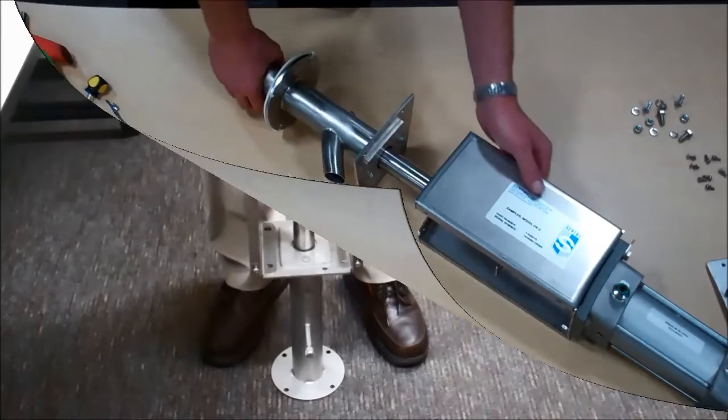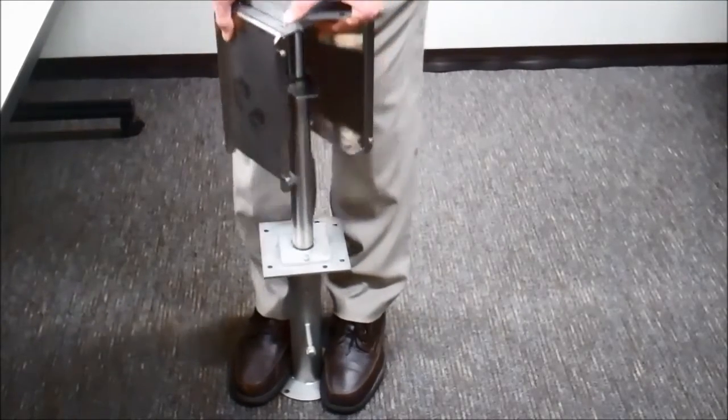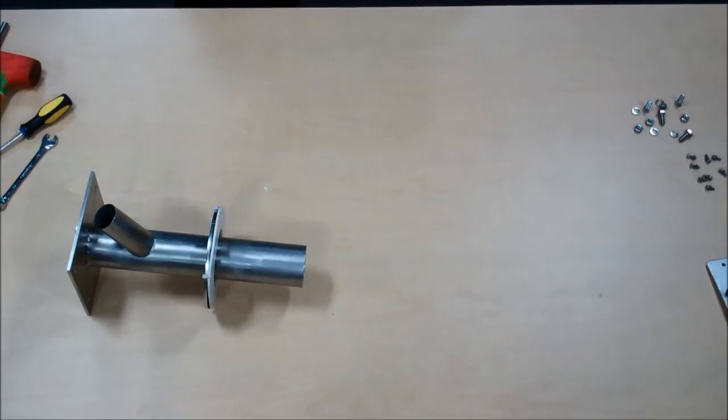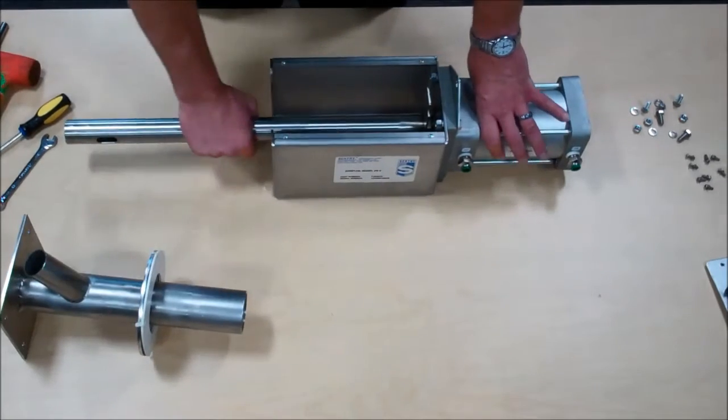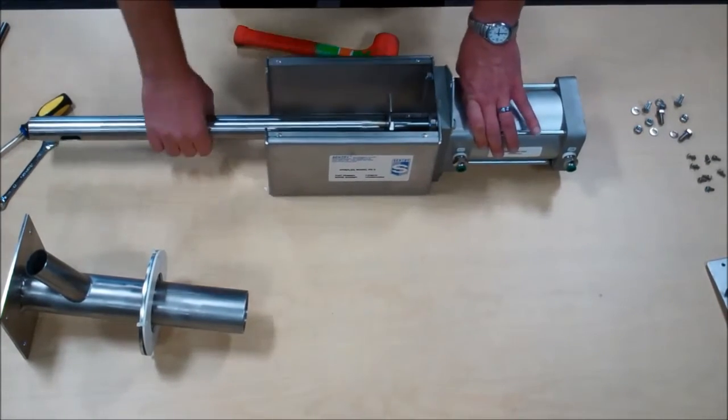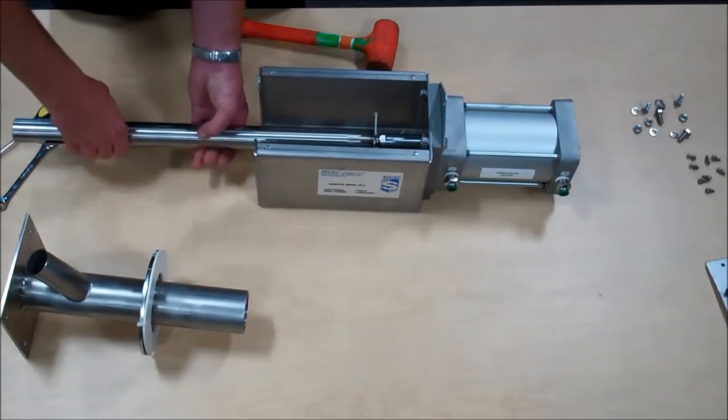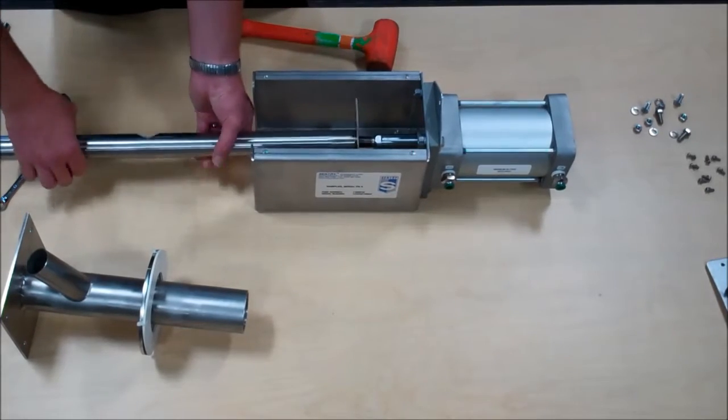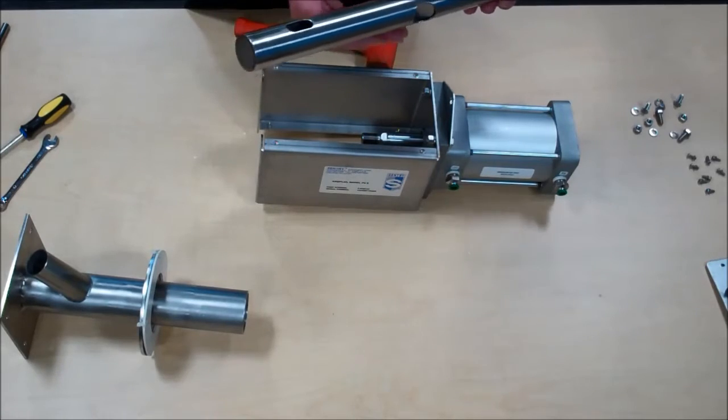It may be necessary to set the sampler on the floor or pull the sampler body and tube separate from the housing. The removal of the sample tube is done via a sharp blow to the guide plate on the tube to knock it loose from the air cylinder. Inspect the sample tube for excessive wear, pitting, or abrasion and replace if necessary.